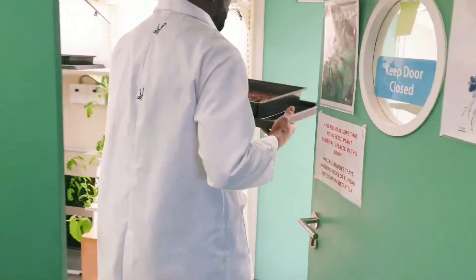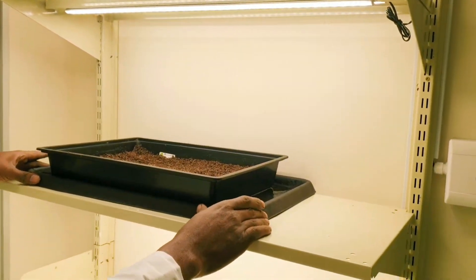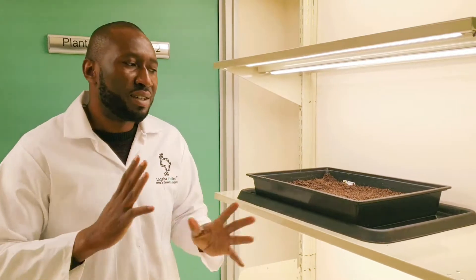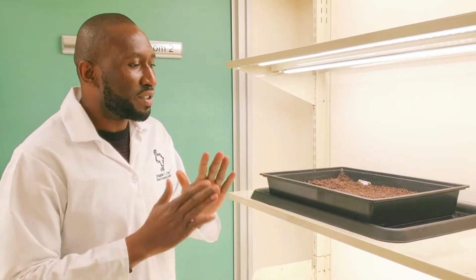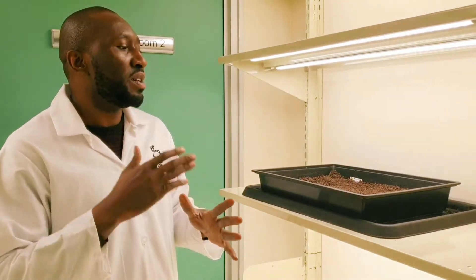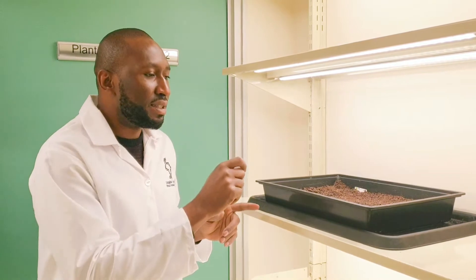This is our plant room. It's going to be in here. Sometimes it takes like one week or more to really see the seedlings. The temperature is controlled, the light is controlled — we are good to go. We give it some time, and after it germinates we can transplant the seedlings. I will show you how.